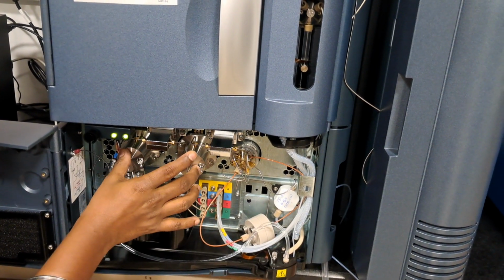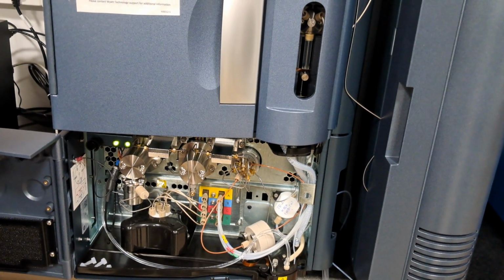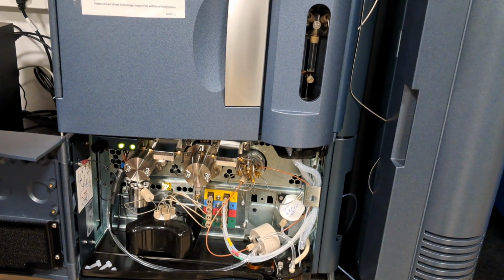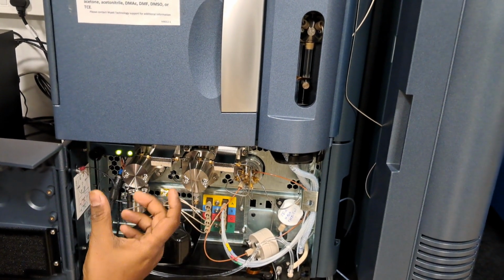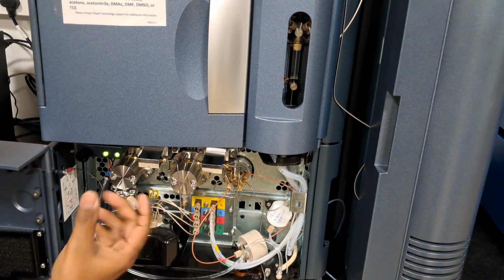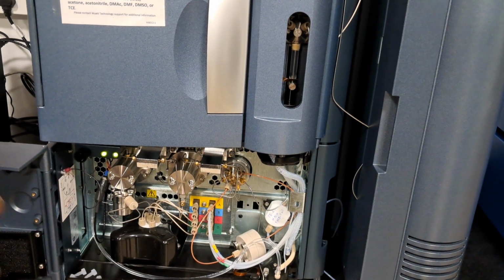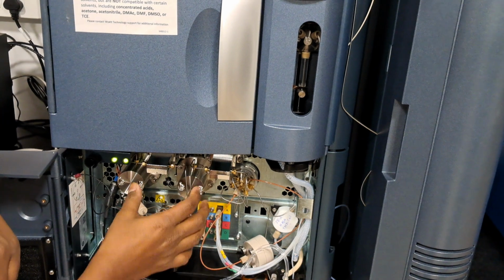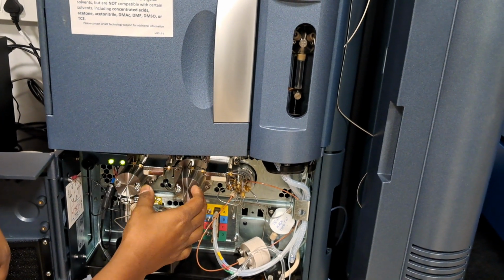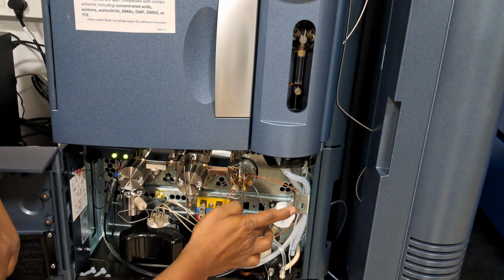The pump consists of seals. That is called the pump seals. It's a piston based technology. The seals are fixed inside the pump, and the piston is inserted in the seals. The pistons move front and back. If you are using a buffer or anything, it gets precipitated in the seals. That is the PTFE material. To clean the seals, we are using the seal wash.